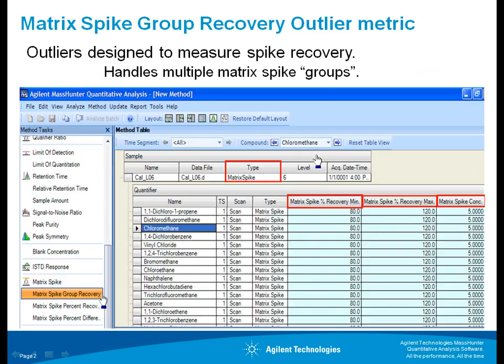And what we've got here is basically a set of outliers that are focused on spiking a sample and then measuring recovery. I will concentrate mainly on the matrix spike group recovery outlier, which is new, but I will cover the others. Here is a picture which shows you the method editor and the setup for the matrix spike group recovery.